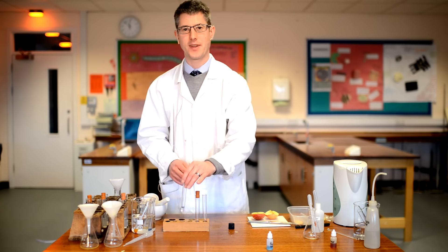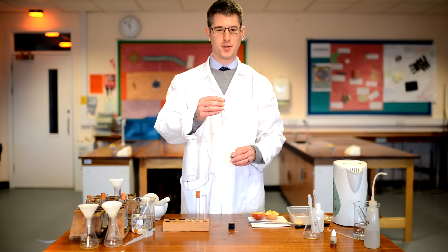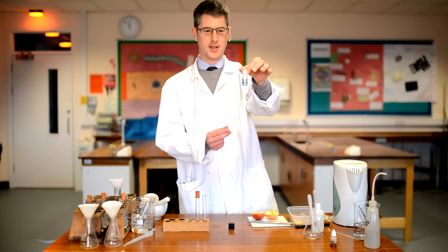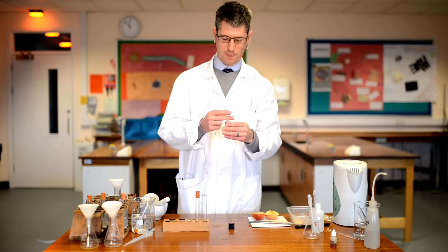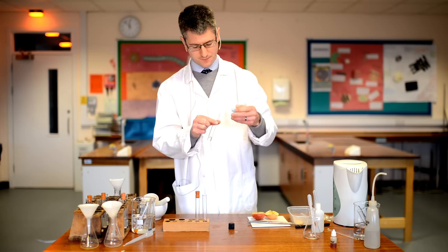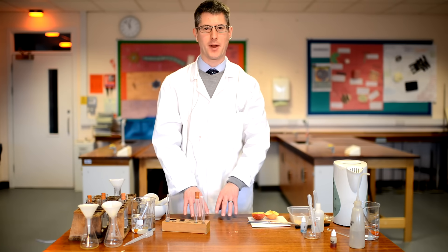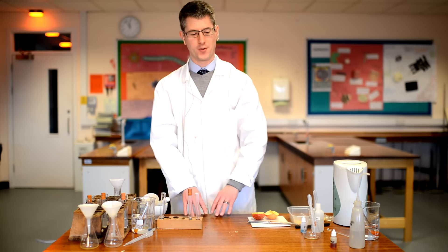The fourth food test is a test for proteins. Again, we have our filtered food sample, and this time we're going to add something called Biuret reagent — this is the test for protein. It's a light blue colour to start with, so we add some to our food sample and leave it to show results later. You add Biuret reagent, it starts as light blue, and we'll see the colour change. That's how we do our four tests.